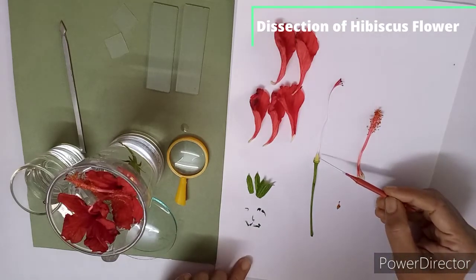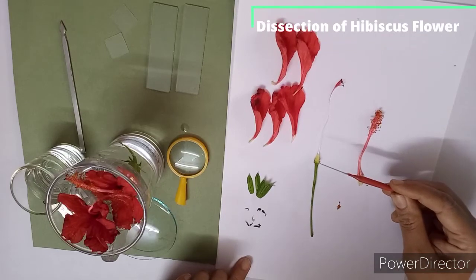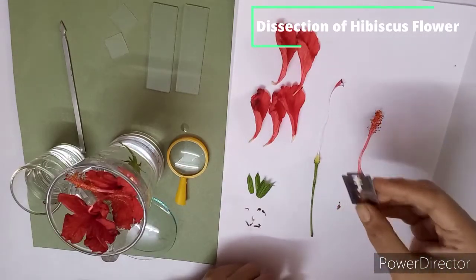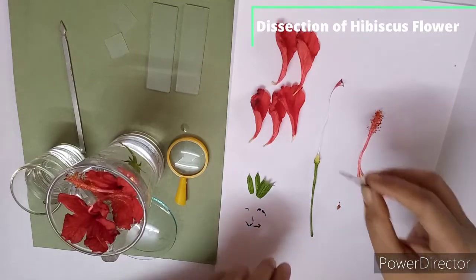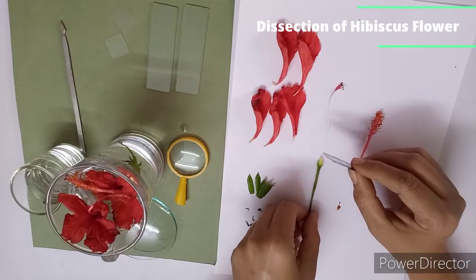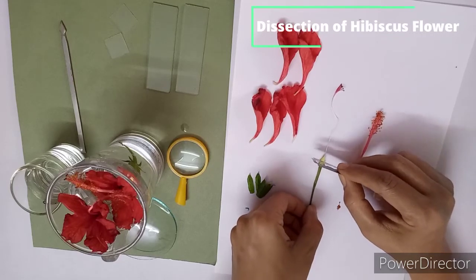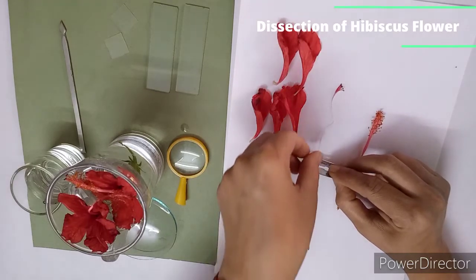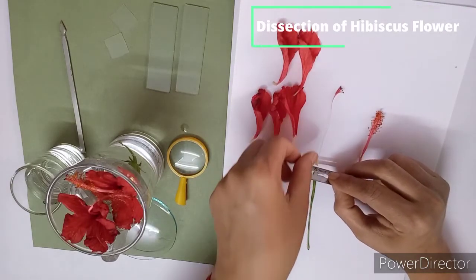ovary, as this is the ovary, and now we are going to cut the section of it. And for that I am using a blade here. You can use a razor also. In your dissection box you will easily find a razor or blade. So very carefully from here you have to cut half of the ovary, yes, and leave the setup like this only.